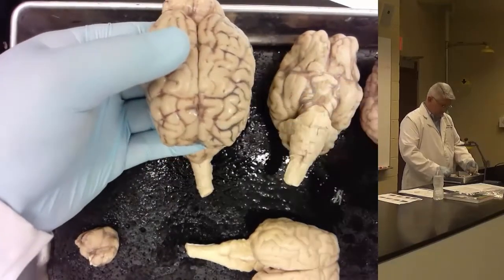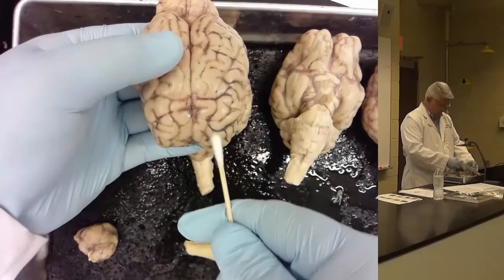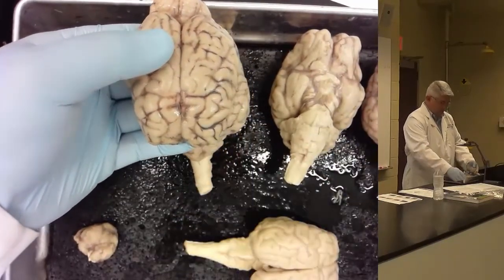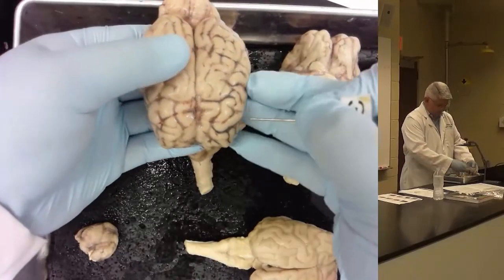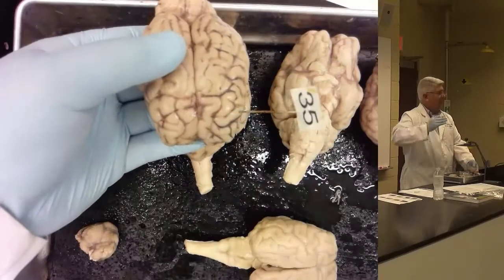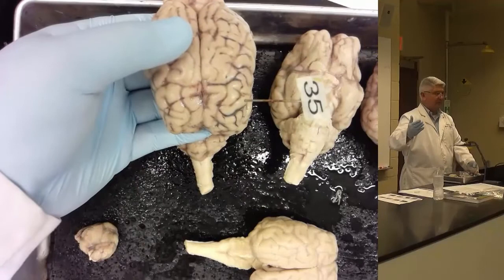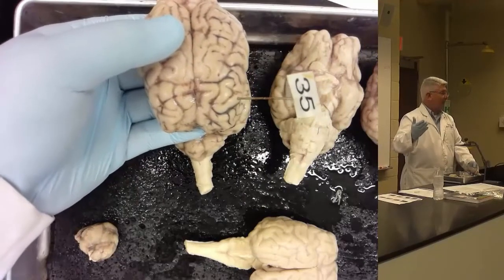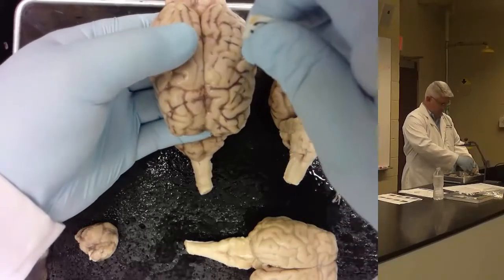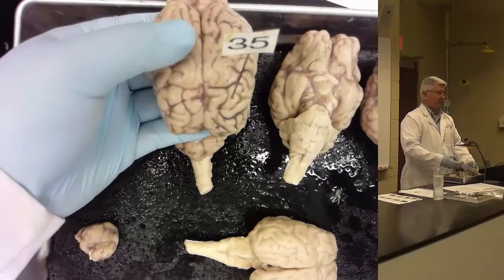Again, the middle frontal gyrus goes all the way through here, even though there's a sulcus running across there, and the inferior would be over here. So how do you know if it's inferior or middle? Well, if it's marked in the 1, 2, 3, the lateral third of the frontal lobe, and it says gyrus, then that would be the inferior frontal gyrus. If it's in the middle third, that would be the middle frontal gyrus.